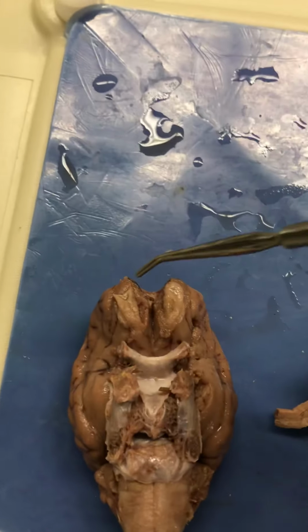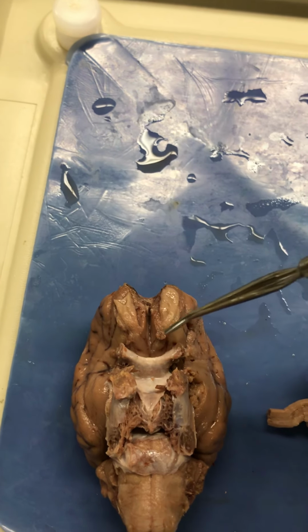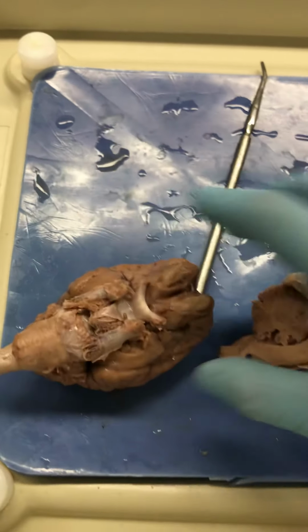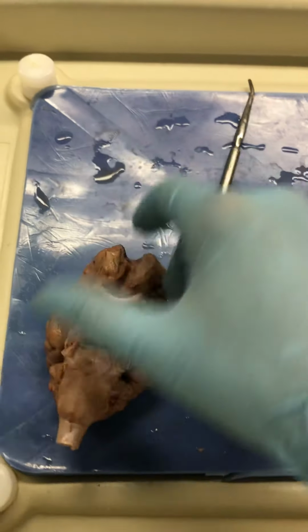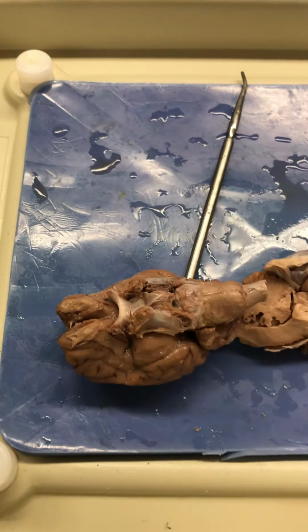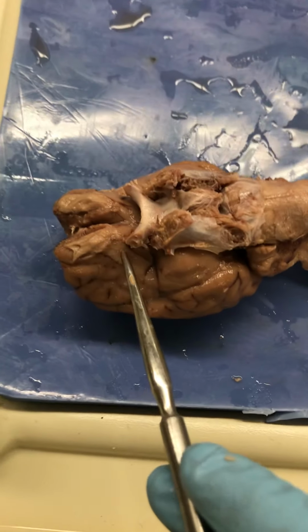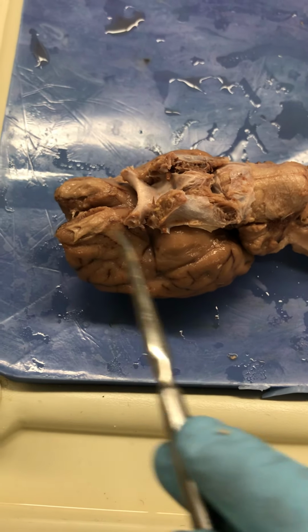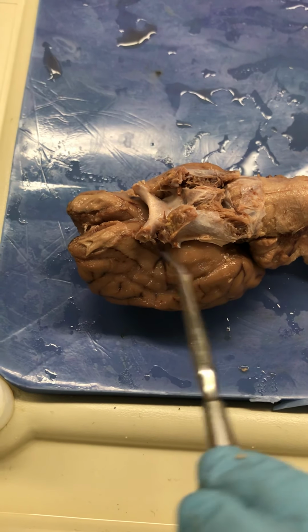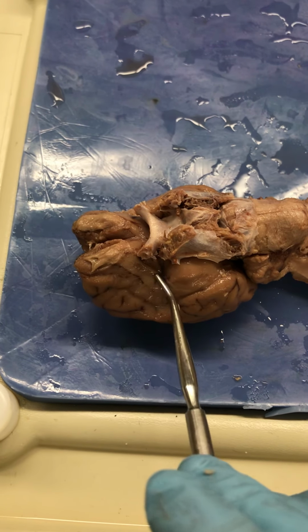So while we're looking at this view here, these are the olfactory bulbs, cranial nerve number one, the bulb part. This is the cluster of nerves that come into the brain. And then I keep mentioning tracts, fiber tracts. So basically, the tracts are the nerves that are actually in the cranium, in the brain. And so this is the olfactory tract here. It goes towards that olfactory cortex. So the olfactory bulb and the olfactory tract.